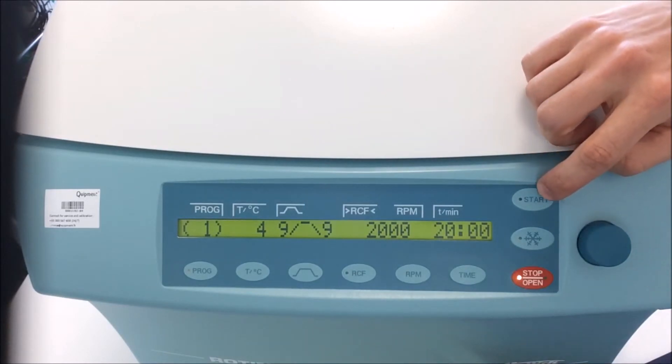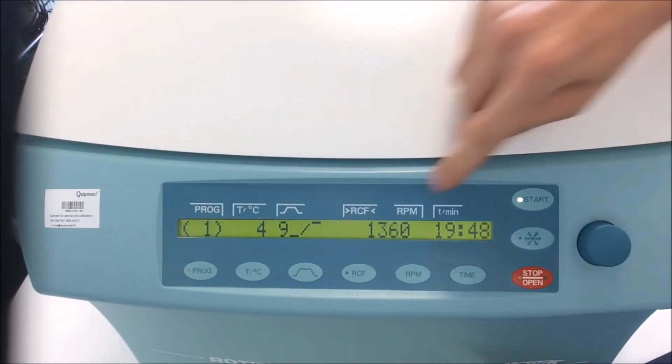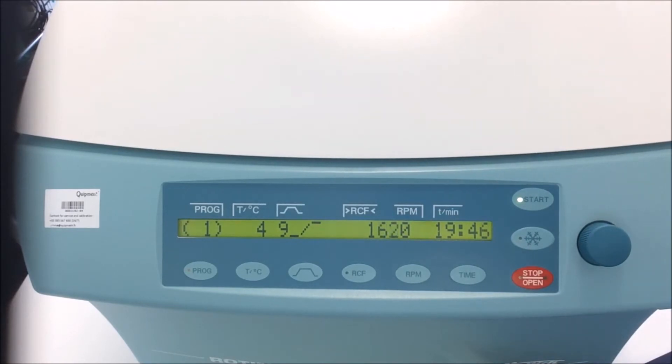I can press on start. You can hear the compressor turning on for reaching 4 degrees, and the speed is increasing, reaching 2000 as defined.